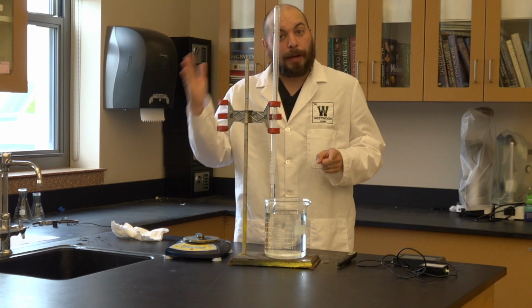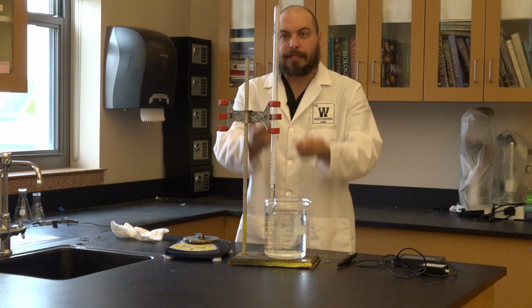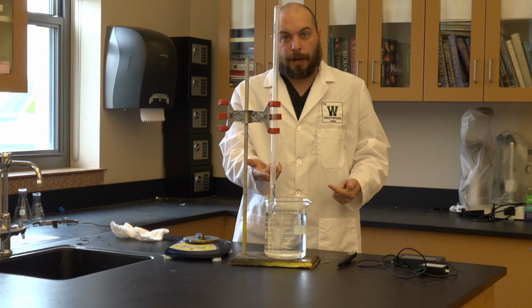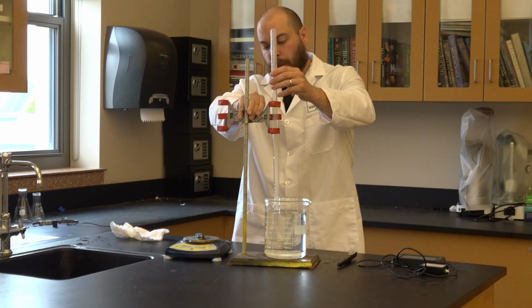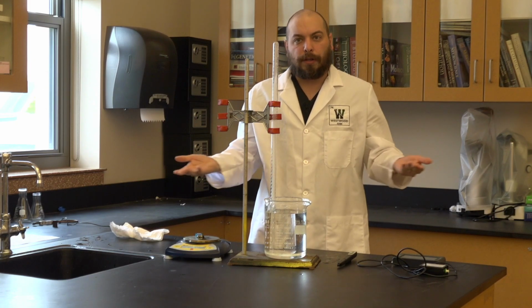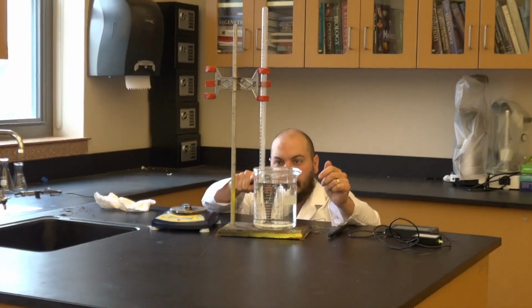The difference between my initial and my final mass, in theory, should be just the mass of the butane that is now in my eudiometer. I need to figure out the volume of the eudiometer now. So I'm going to take my eudiometer and lower it until I see that the gas inside is at the same level as the water level outside. It's going to require me to get down and take a measurement.